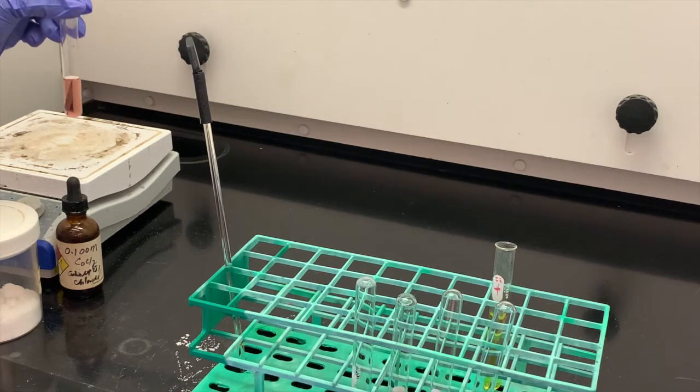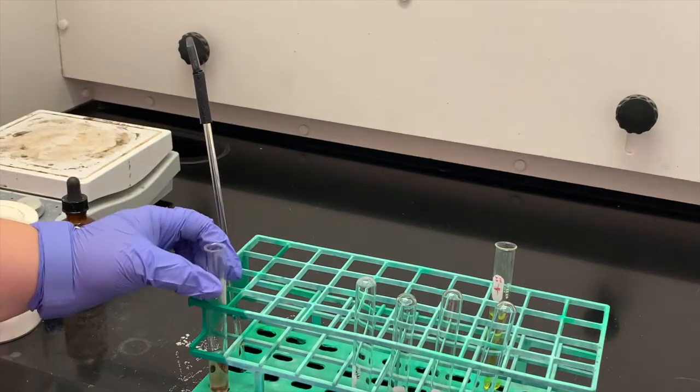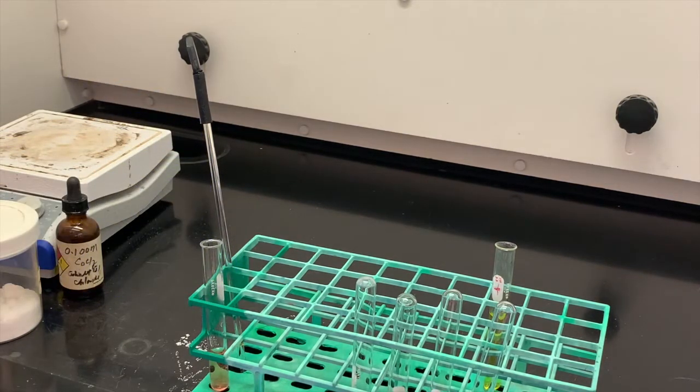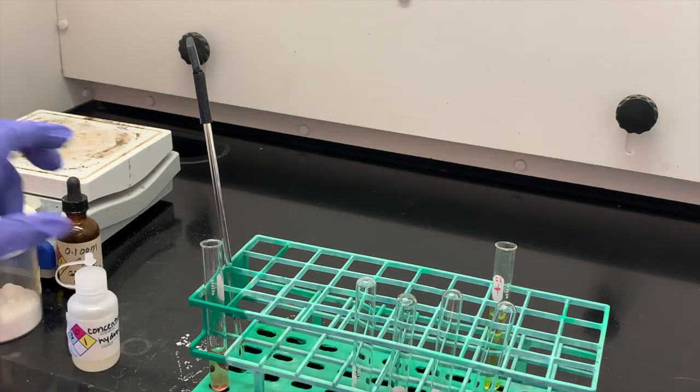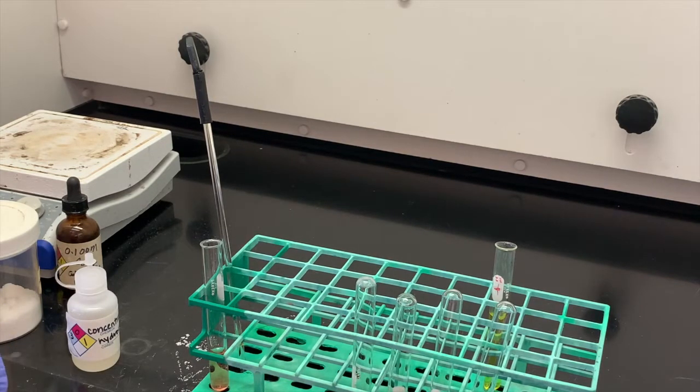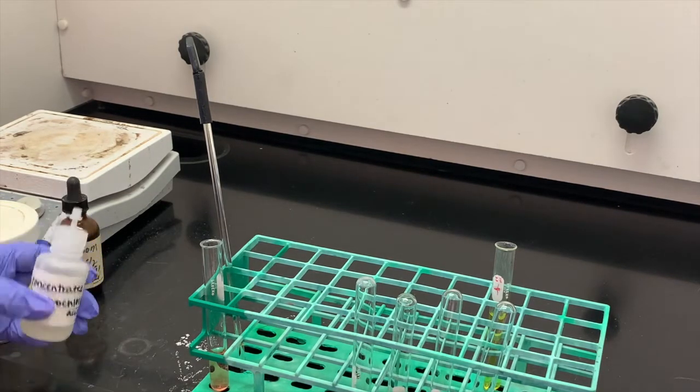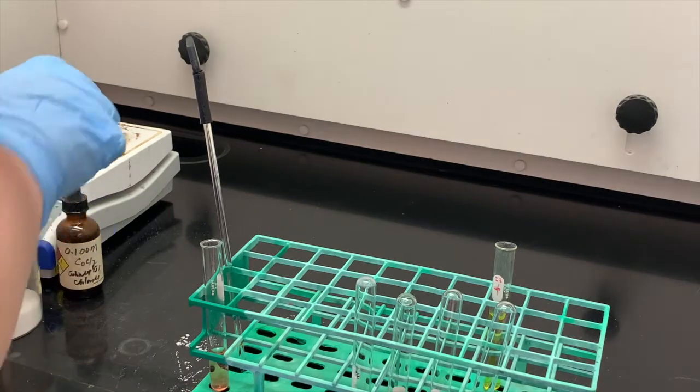So notice I am working inside the hood today. I don't want to breathe in any of these fumes from any of these chemicals. So we're going to add the concentrated hydrochloric acid until we see a color change again.